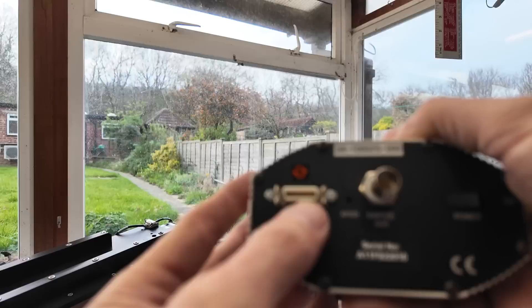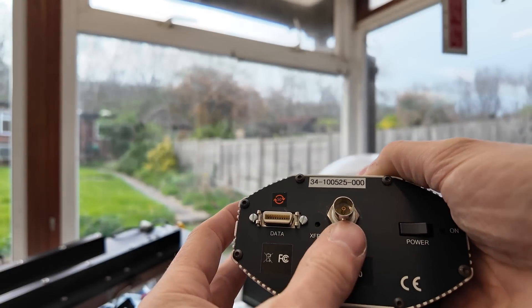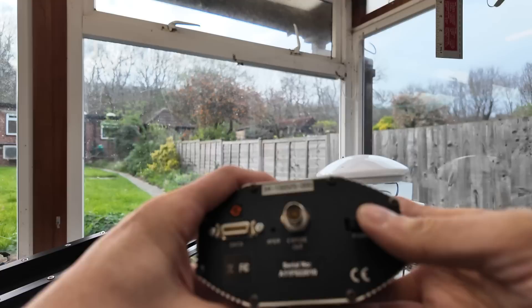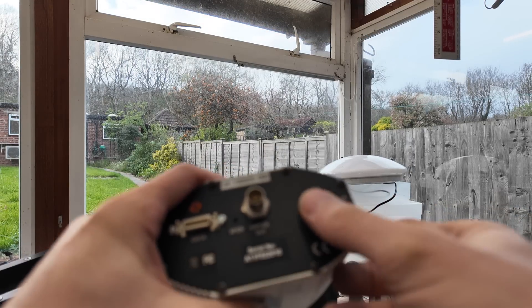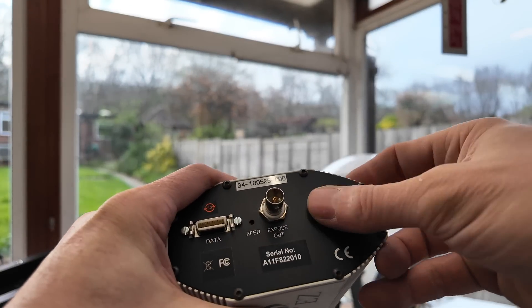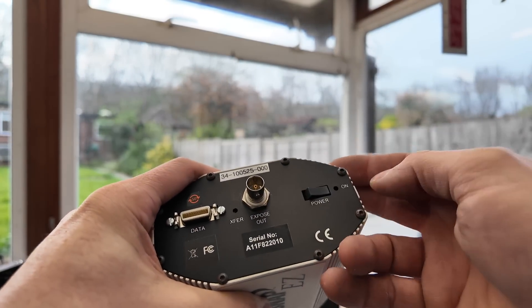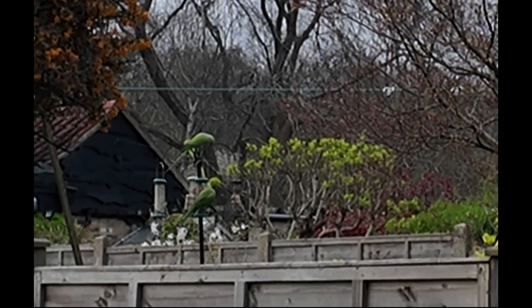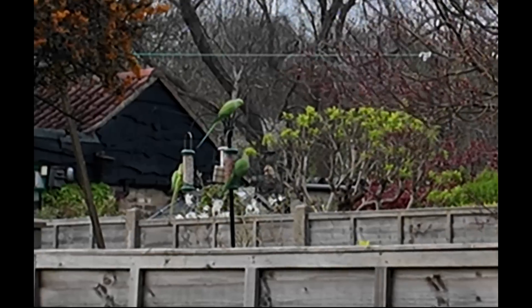Single power/data connector to that PCI card. There's an expose-out connector — that's probably a trigger. There's a power switch, though I'm not quite sure why you'd bother having a power switch on something like this, because obviously it would be tethered to the PC and powered from that. Excuse all the noise — we've got some rather noisy parakeets that have taken up residence next door.